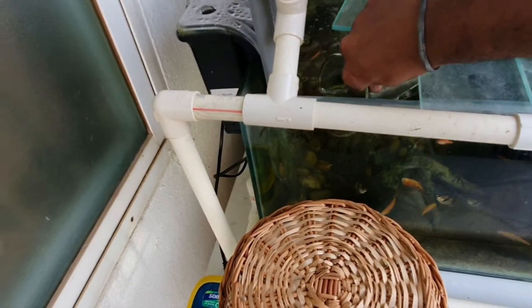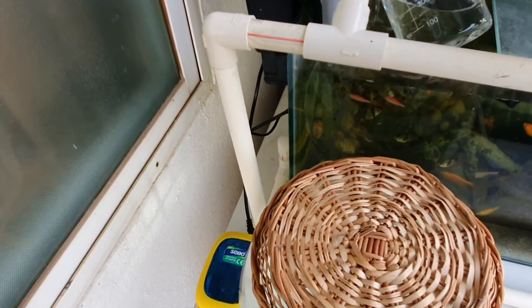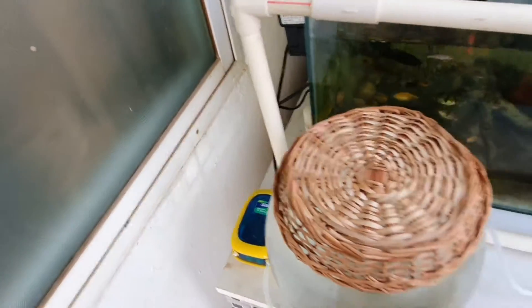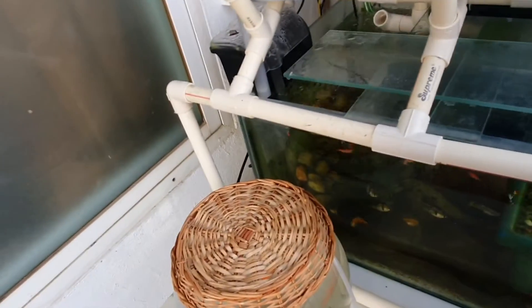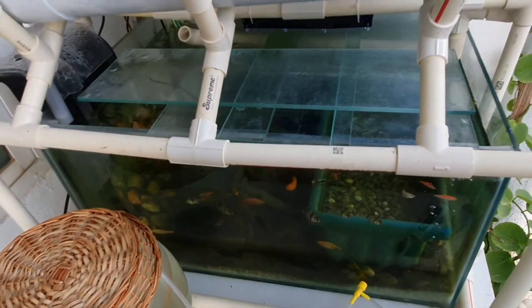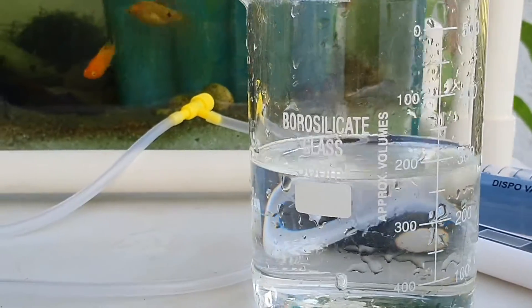Let's do it the easier way. I'll put this beaker inside and get some water — a similar volume, around 250 ml — out of it. I'll pour it back. Let's get rid of some more. I want to be consistent with my tests.